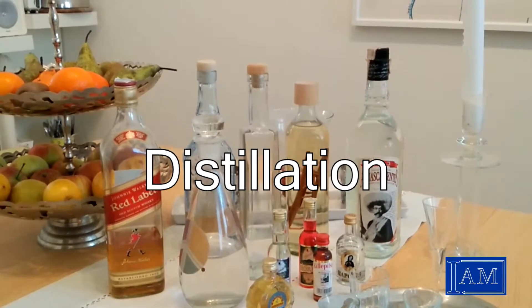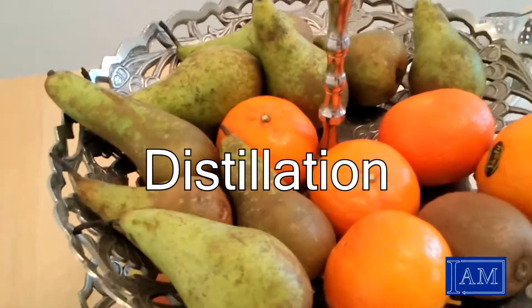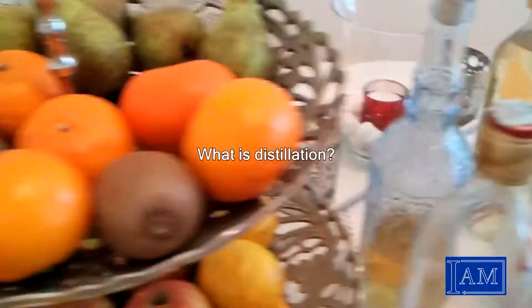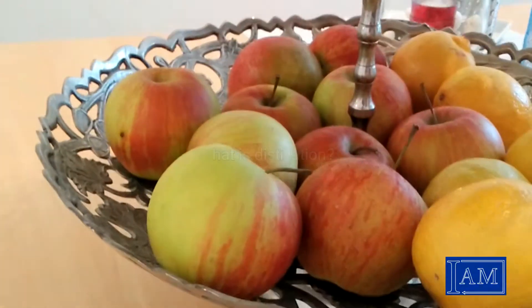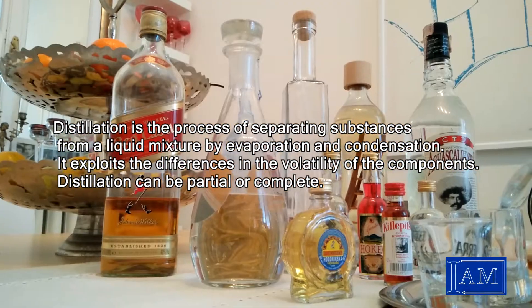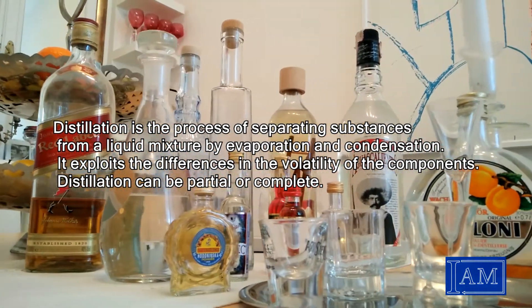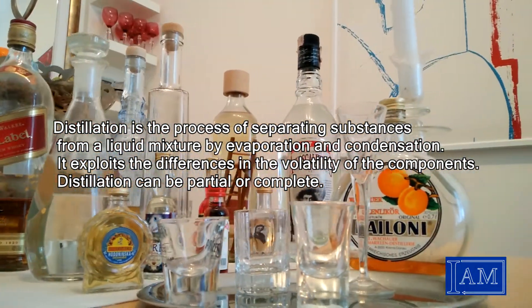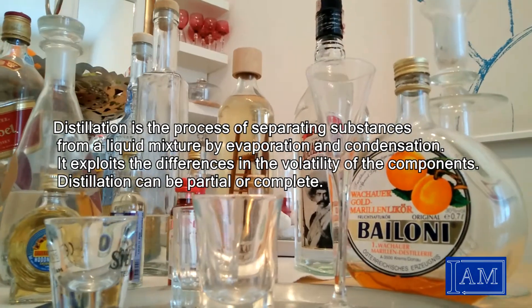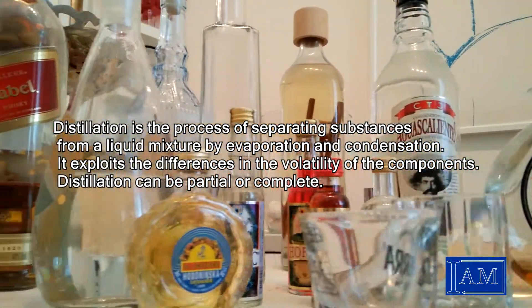Distillation. What is distillation? Distillation is the process of separating substances from a liquid mixture by evaporation and condensation. It exploits the differences in the volatility of the components.